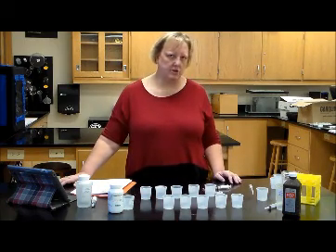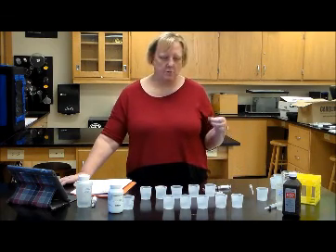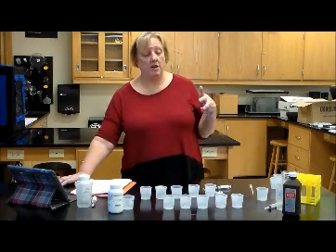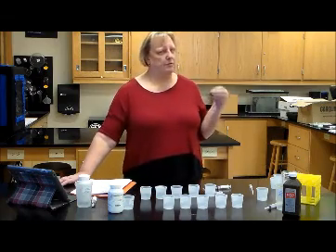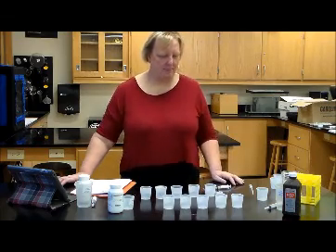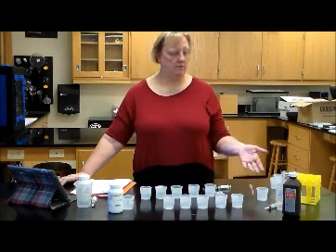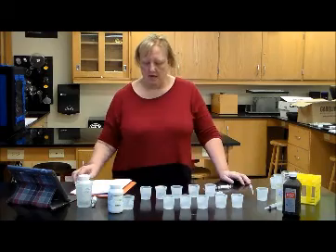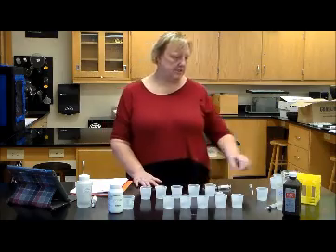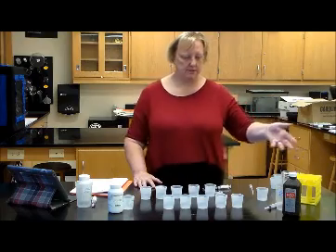Catalase is found in nature in beef and potatoes and avocados. So we could be using liver, beef liver for this, or we could be using chicken liver or potatoes or avocados. I'm going to be kind to you and let you use avocados because beef liver is kind of gross. Anyway, one of the first things you'll do is test the avocado with the catalase and see what happens. Another thing you'll do is boil the catalase in the test tube and then react it again with some hydrogen peroxide to see what happens.